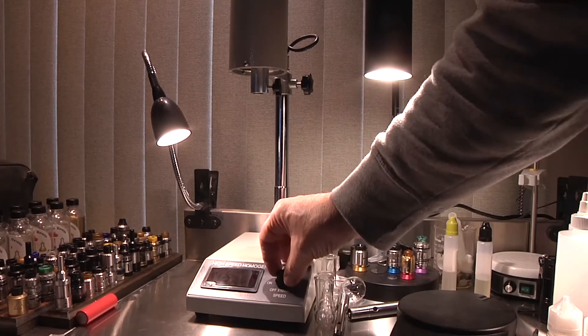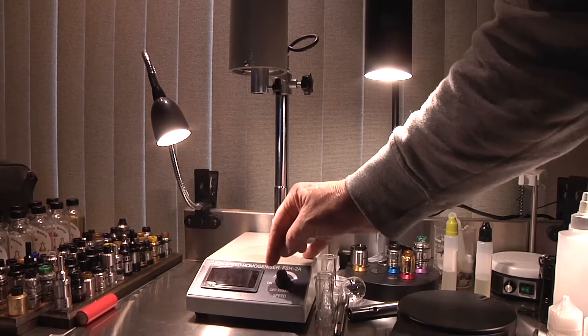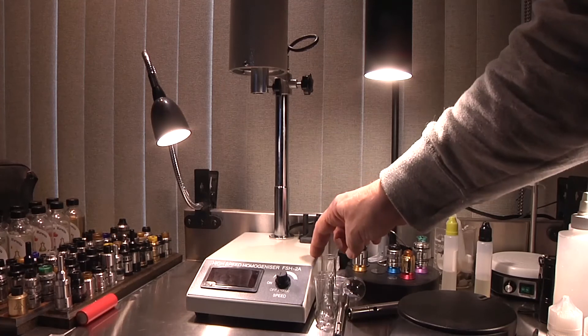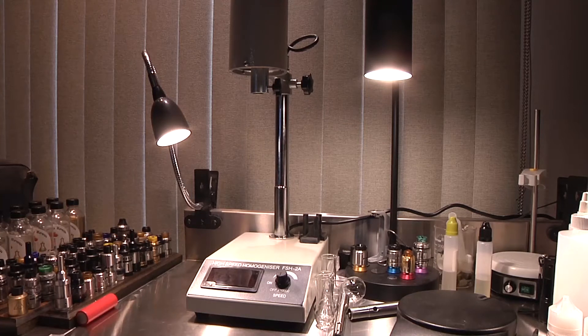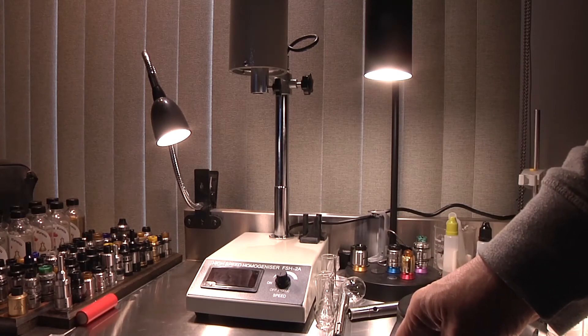Here's our switch. It does have a click on and off at the bottom, and from there it's a variable resistance pot that turns up the speed of the motor on the top. We have a display — I'm not entirely sure what it's showing. It says it's showing the actual RPM. I don't know if they're actually monitoring that or monitoring a voltage representative of the RPM, but at any rate it shows that as you turn it up the thing is going faster, and you can also hear that in the motor as it winds up.